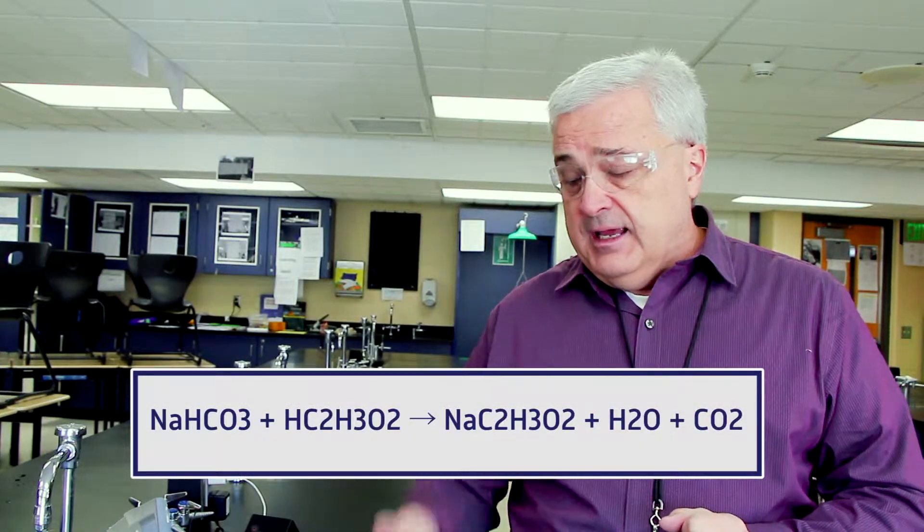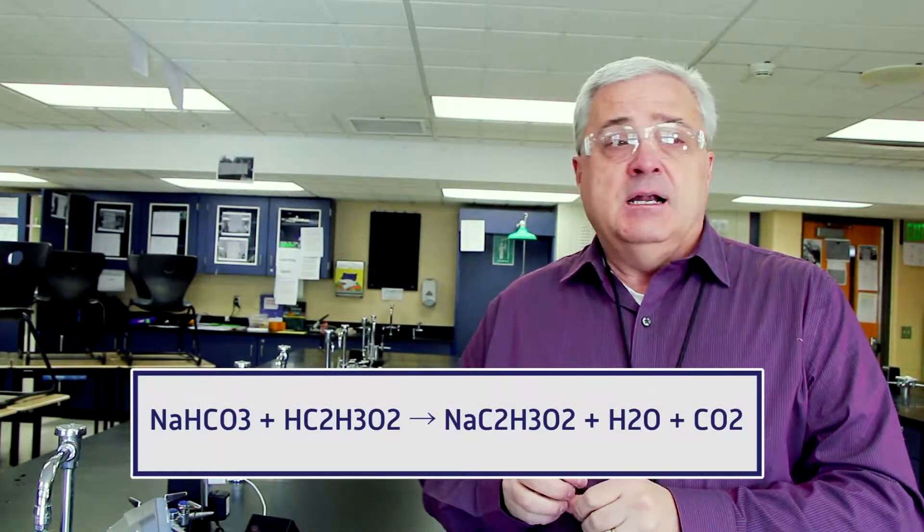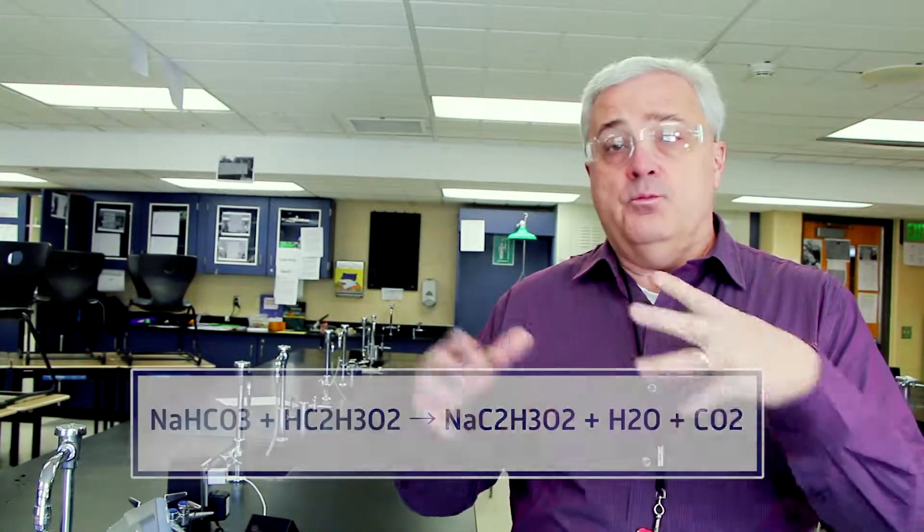In this video, we're going to do a very basic chemistry experiment. The purpose of the experiment is to ultimately determine the number of moles of carbon dioxide that's going to be produced in a reaction between sodium bicarbonate and acetic acid. To do this, we're going to need the molar mass of the carbon dioxide.